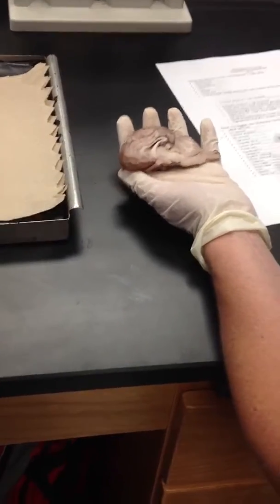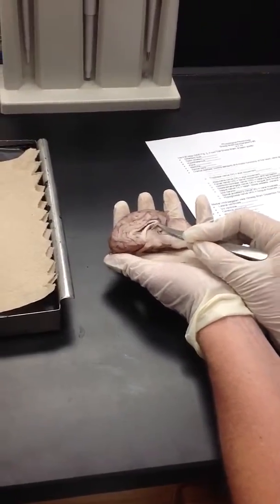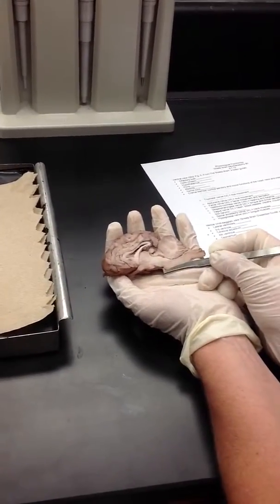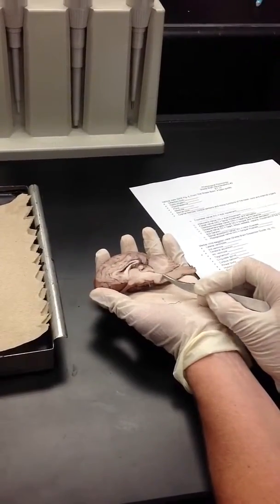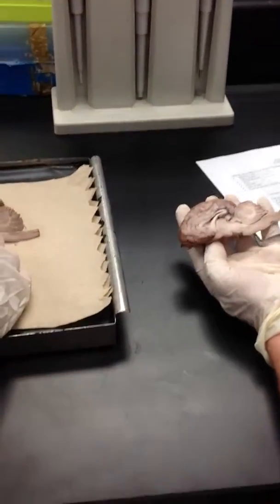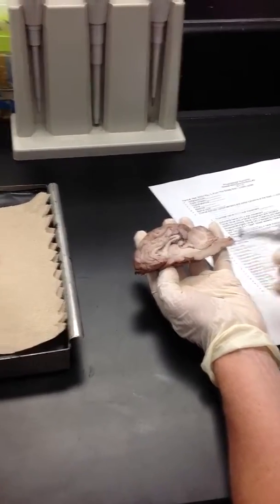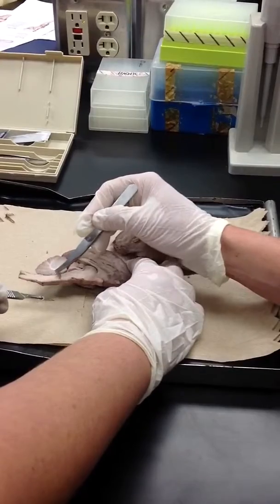All right, so we've got the superior and inferior colliculi from this view, the thalamus, and then gray matter and white matter. From this angle, you also want to be able to identify some of the brainstem structures. So here's the pons, that little bulge there. And then the medulla behind that. Your pons is right here, and your medulla goes from here to here, and then spinal cord. It looks all like one little thing.